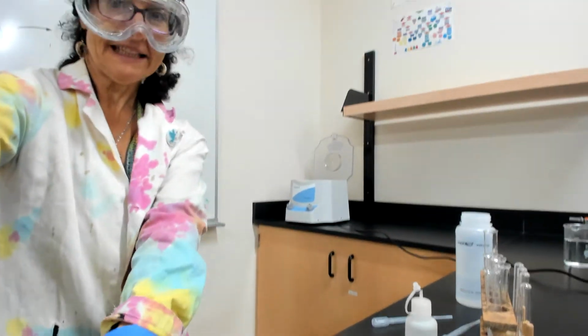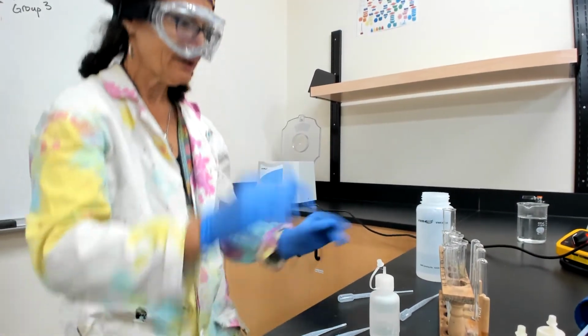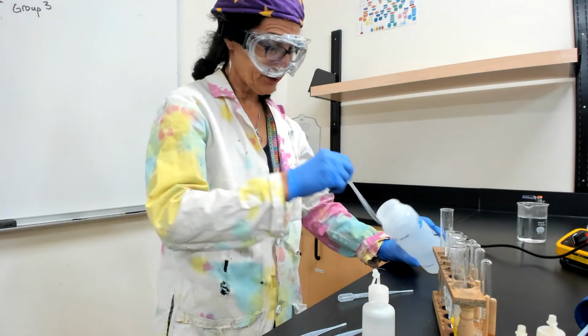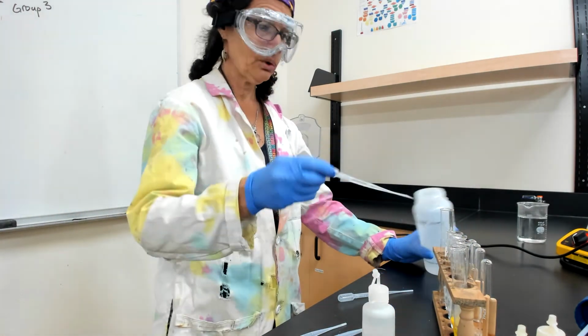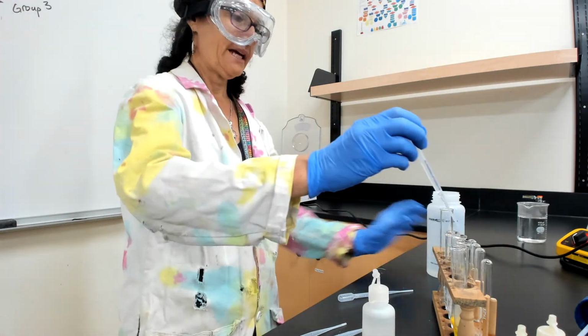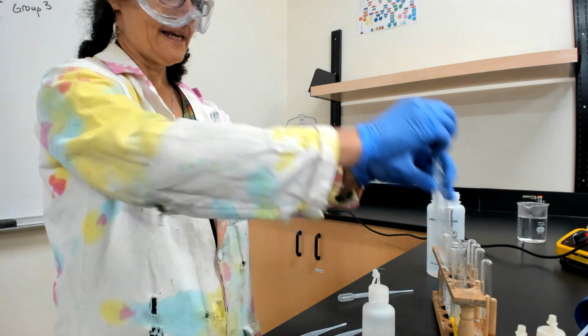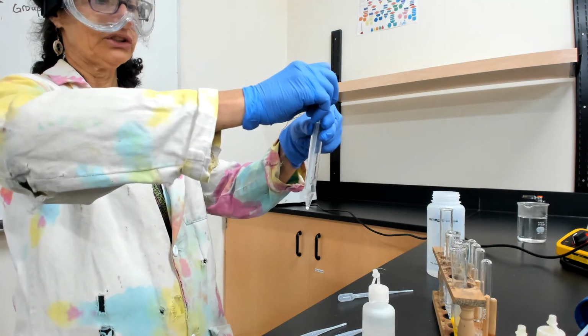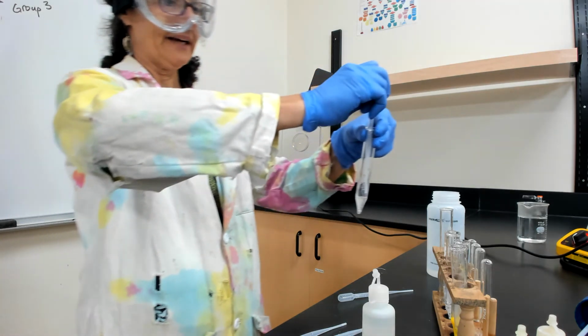All right, do you want to feel like you're part of the action? Look at that, test tube rack. I have to get really low. All right, so back to our precipitates. We add a little bit more water. Dilute it a little bit. And in the instructions, you would clean it, do all that good stuff.